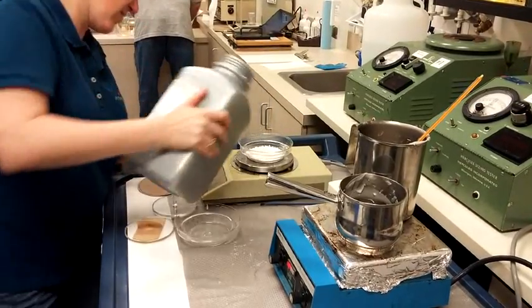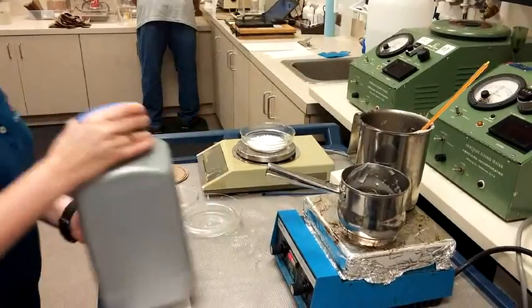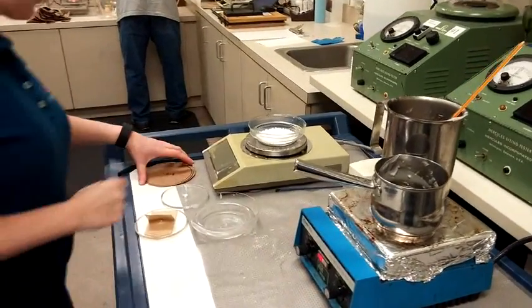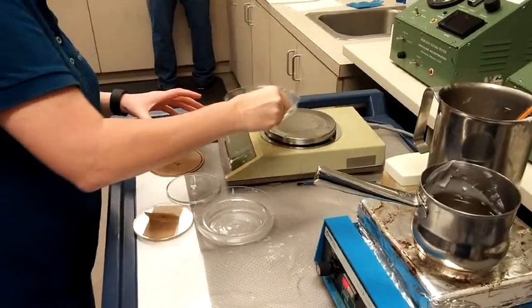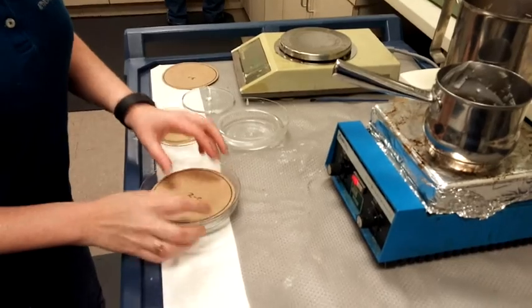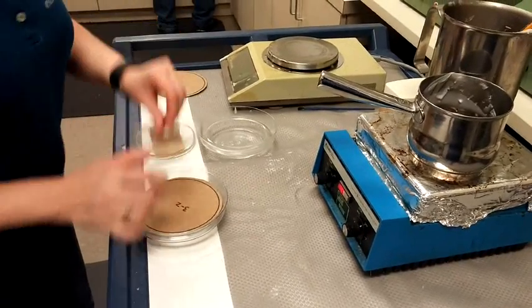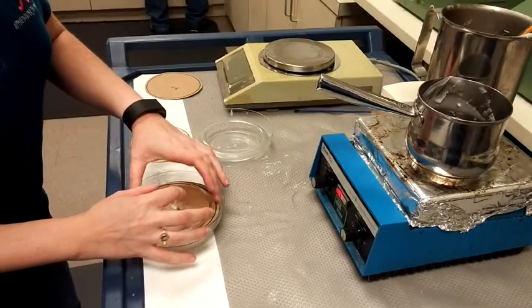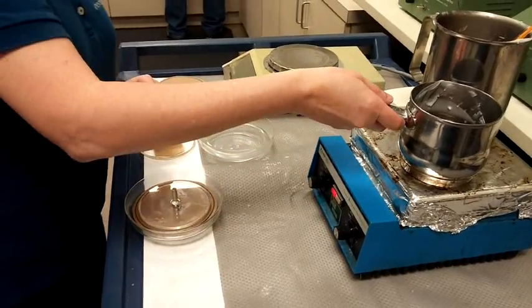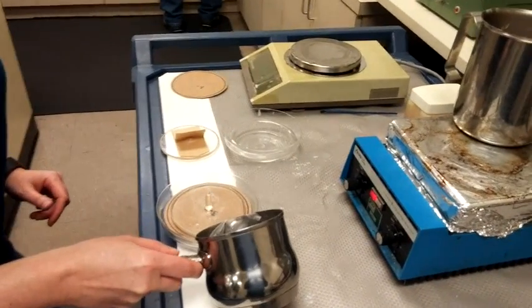A specified relative humidity is on one side of the sample and a desiccant is on the other side. The change in the weight of the desiccant over time is a measure of the transmission of water vapor through the substrate. The test is usually run for three days with a measurement taken after each day. The water vapor transmission rate is calculated and is reported in grams per square meter per day.